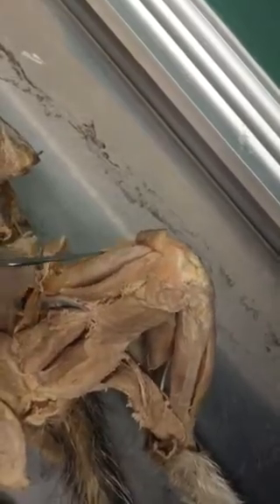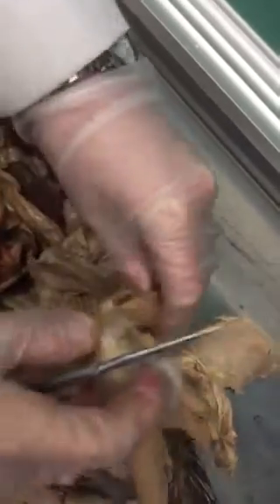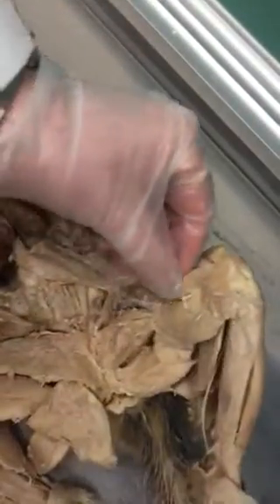Okay, under the sartorius. The sartorius is the longest muscle in the human body. Under the sartorius is the rectus femoris. That's why I call it the hot dog in the bun. You have the vastus medialis and the vastus lateralis. You could also see the vastus lateralis from this side. So this is the vastus lateralis, rectus femoris, vastus medialis, and under the rectus femoris is the vastus intermedius. That's extension of the leg. These are the four quad muscles, so you definitely have to know those.